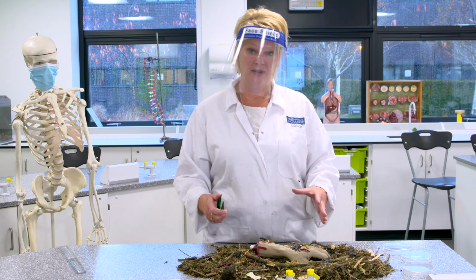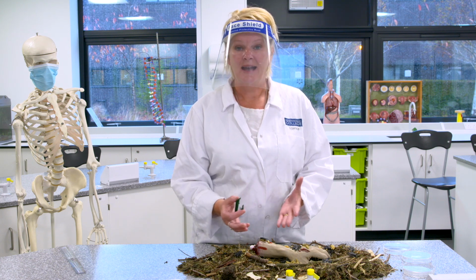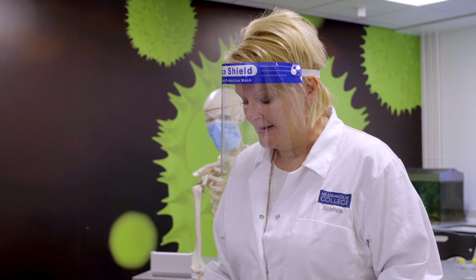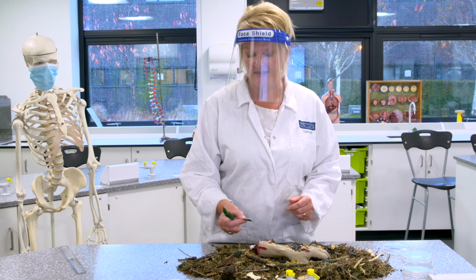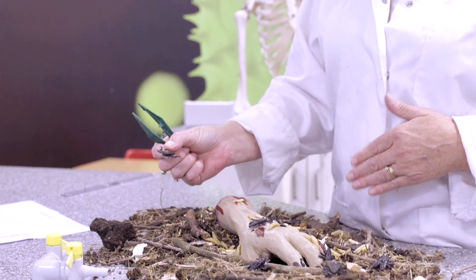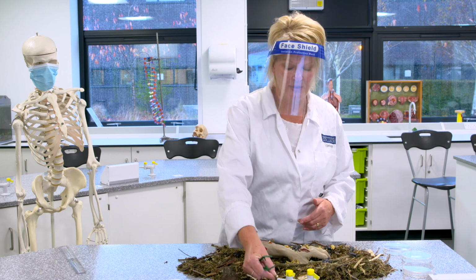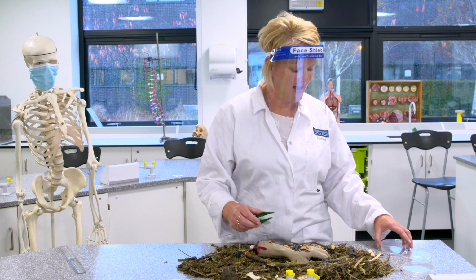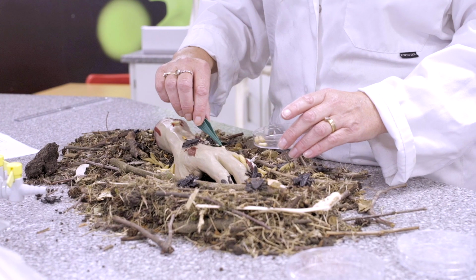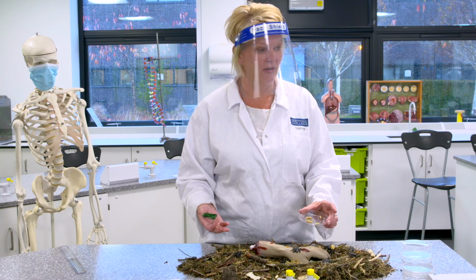So what we can actually do at a crime scene is collect all the insect activity, and we can measure the maggots to work out how old the maggots actually are. We'd first of all collect the adults, and we would identify what species of fly they are. So we are going to presume for this case that these are blowflies. Blowflies are the ones that are attracted to flesh straight away. So we've identified them as blowflies. So now all we're going to do is collect all the maggots that we find. And we'd collect every single one, and we would measure every single one, and we would get a mean size of the maggots.